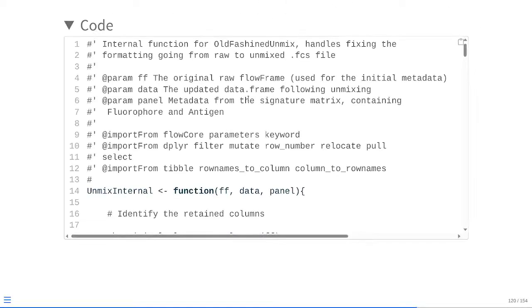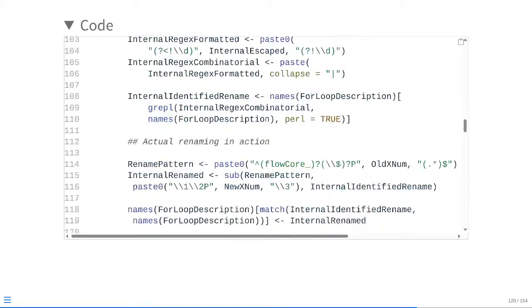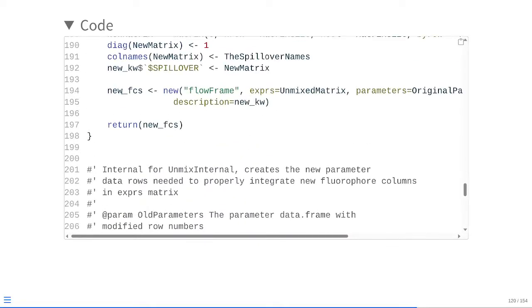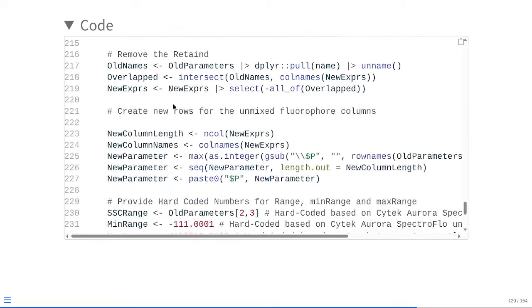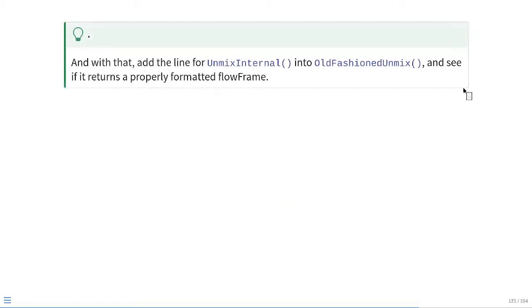So just to terrify or intrigue you, depending on which side of that argument you end up on, this is UnmixInternal. As you scroll, there are some complicated things like cleaning up the description list, making sure the parameters are updated, and then finally pasting them all together into a new flow frame object. And of course, it also has its own little helper function to mediate the process. But if you don't want to deal with these internals, you just have to run the code chunk they're located in, which makes these functions available in your local environment, and therefore you're able to use them within our old-fashioned unmix. So let's go ahead and do that by adding in UnmixInternal, which returns the properly formatted flow frame so that we can proceed downstream.